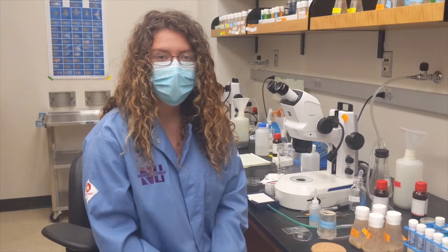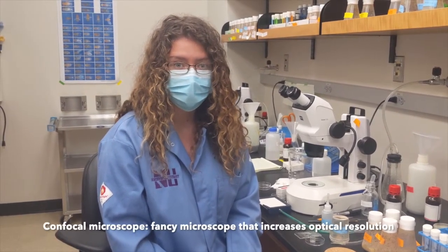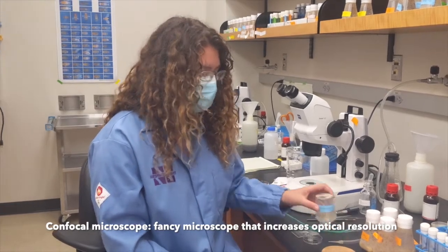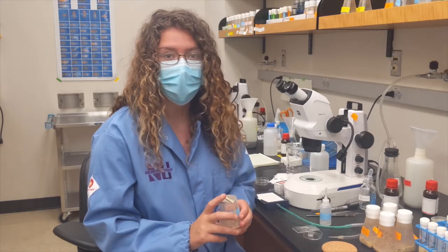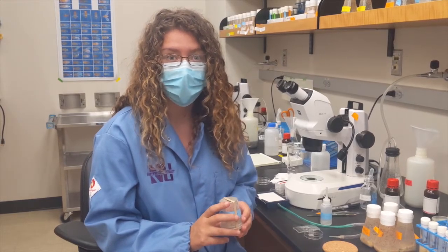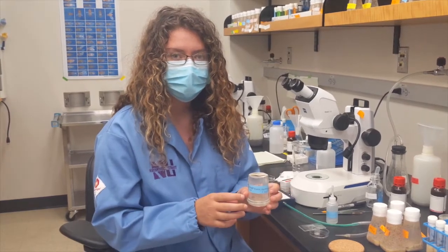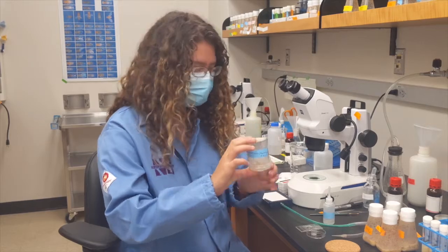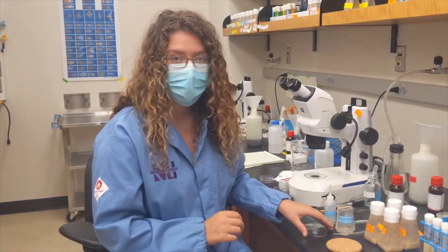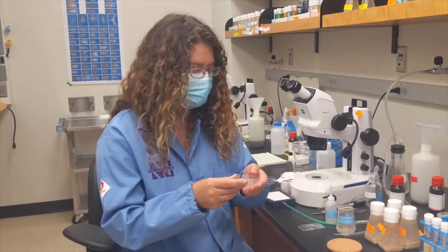A lot of my research involves making movies of developing fly embryos using a confocal microscope. To get embryos that express fluorescent proteins, I take male and female flies that have the correct transgenes and then put them in a plastic cage together. The flies then lay embryos on this bottom plate here. I then pick up the embryos with tweezers and place them in this small plastic bucket.